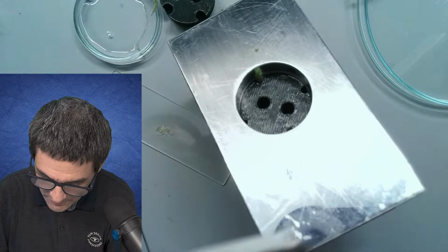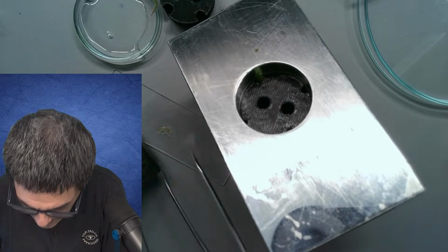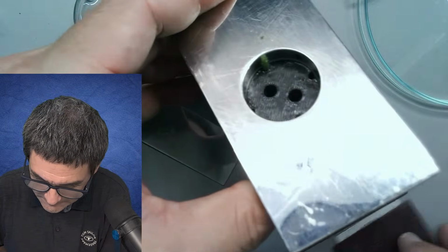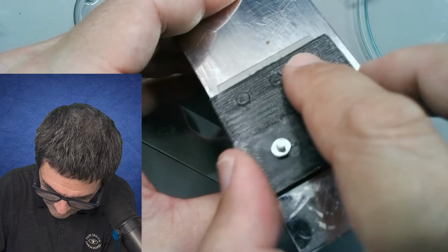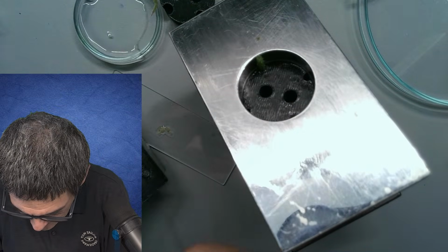Yeah, so here, that's another one. Here we go. I'm just gonna make another cut. Yeah, this one was not so nice.